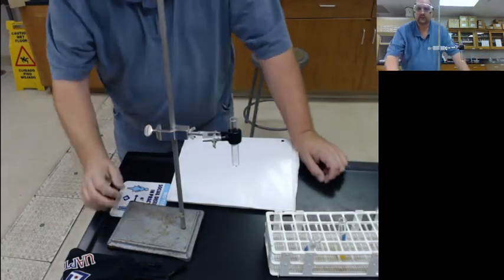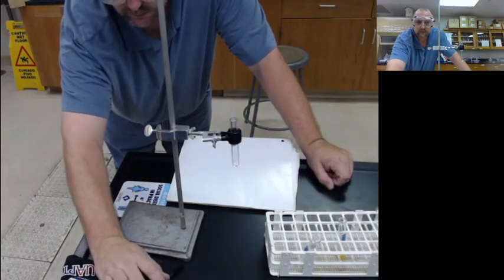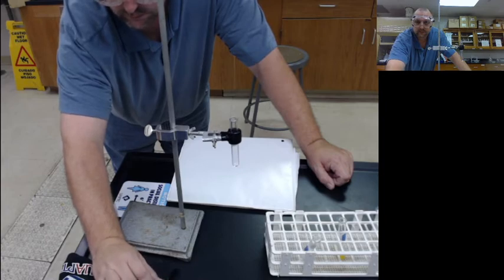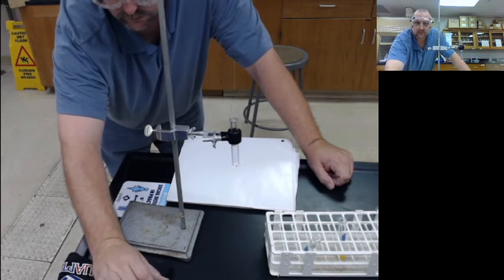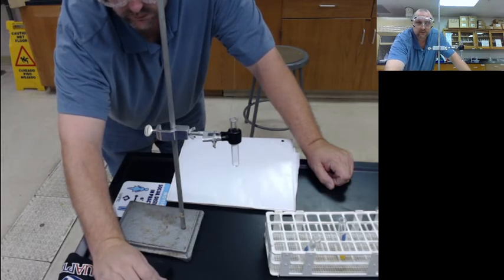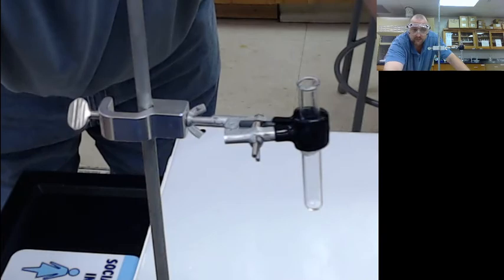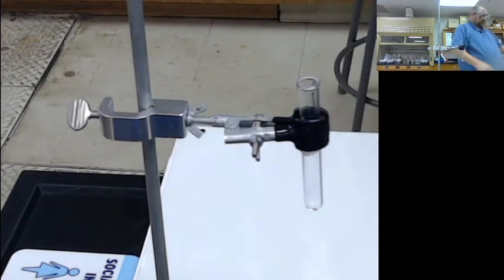Let's do another one. Now we might be able to see here.